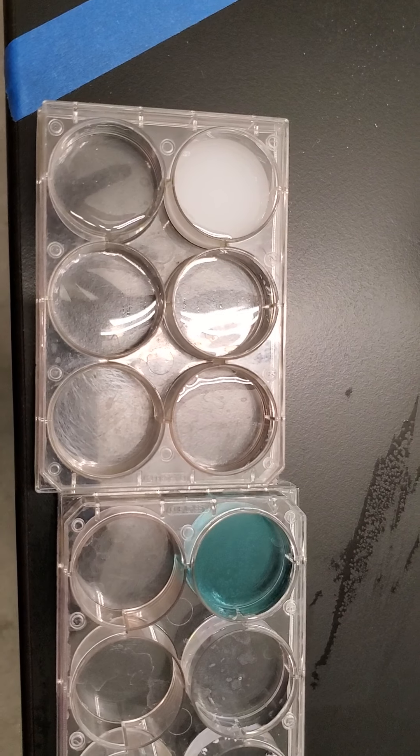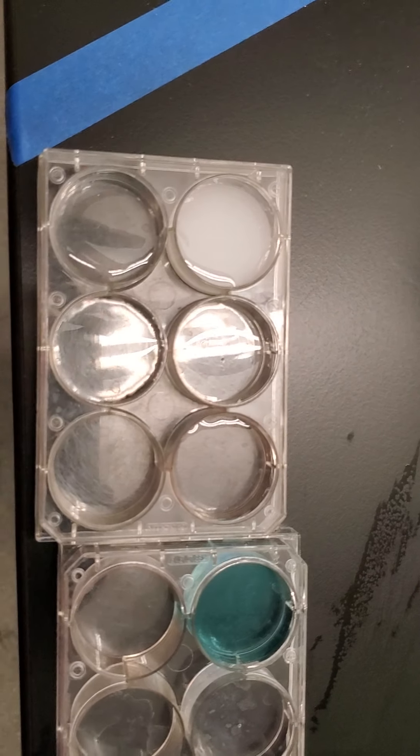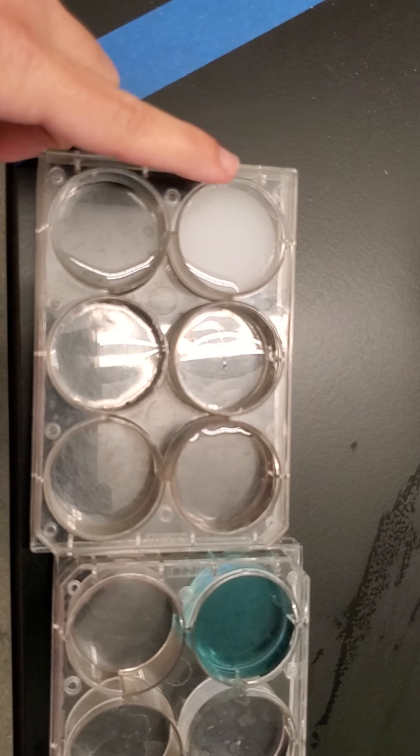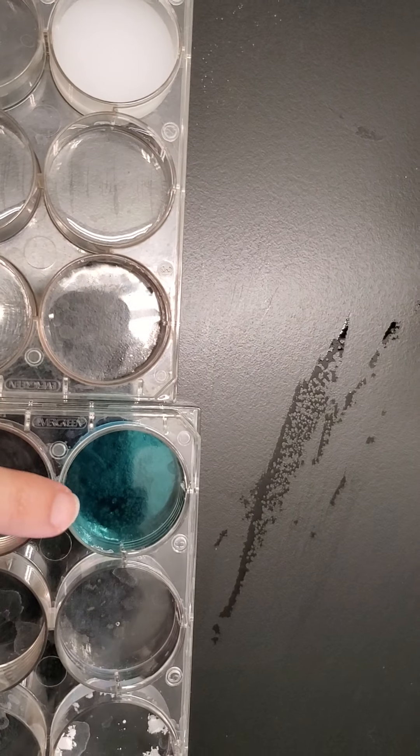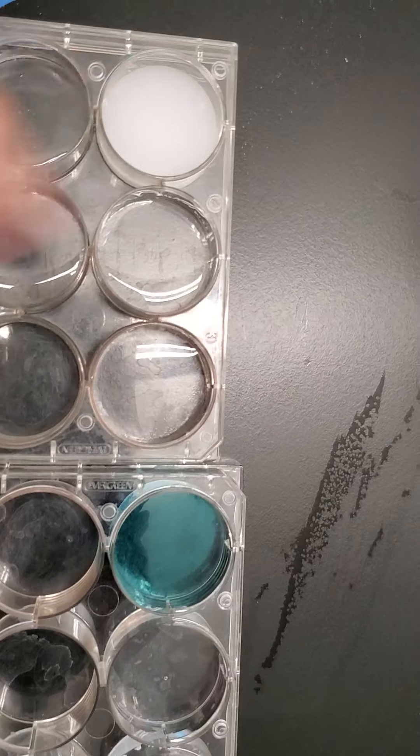Okay, so now we're at the conductivity portion. The samples I have poured into these testing trays. Sample one, two, three, four—you can tell four from the blue color and one from the white color.